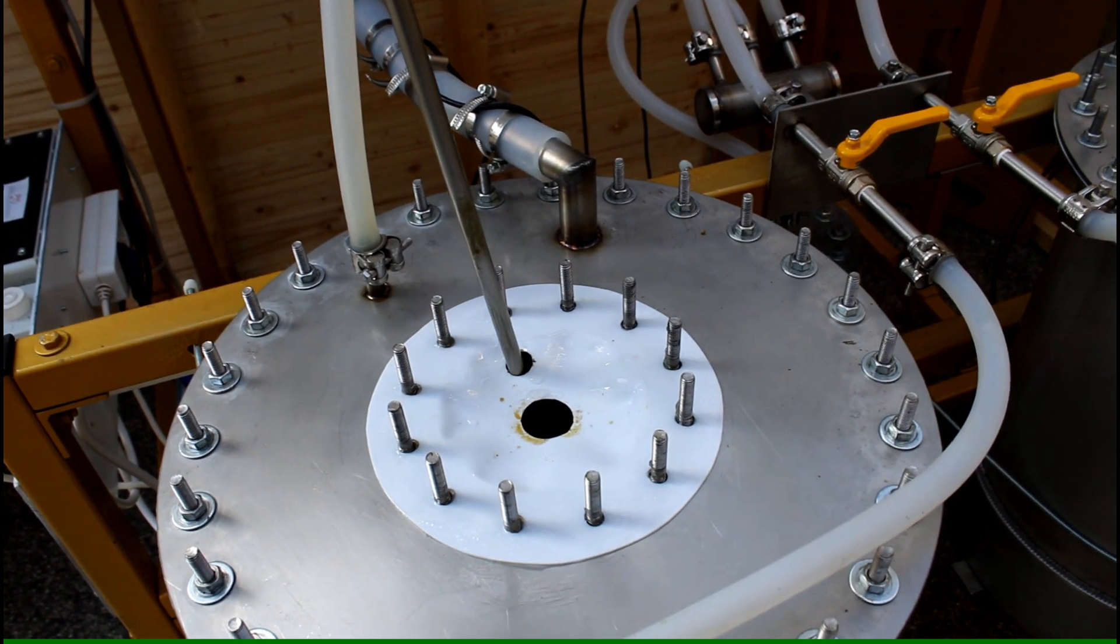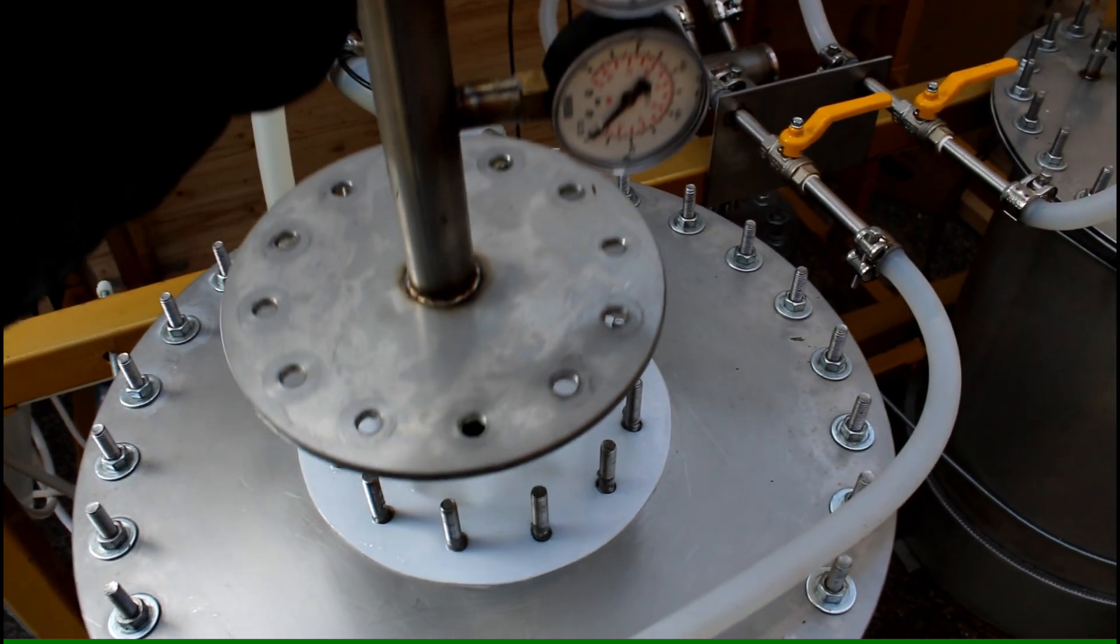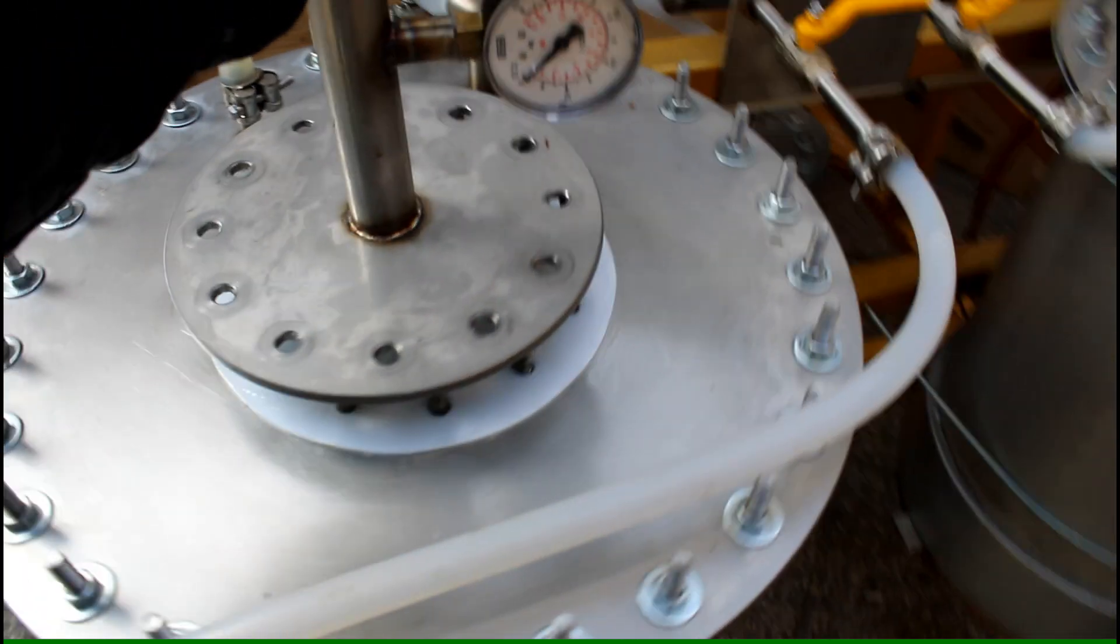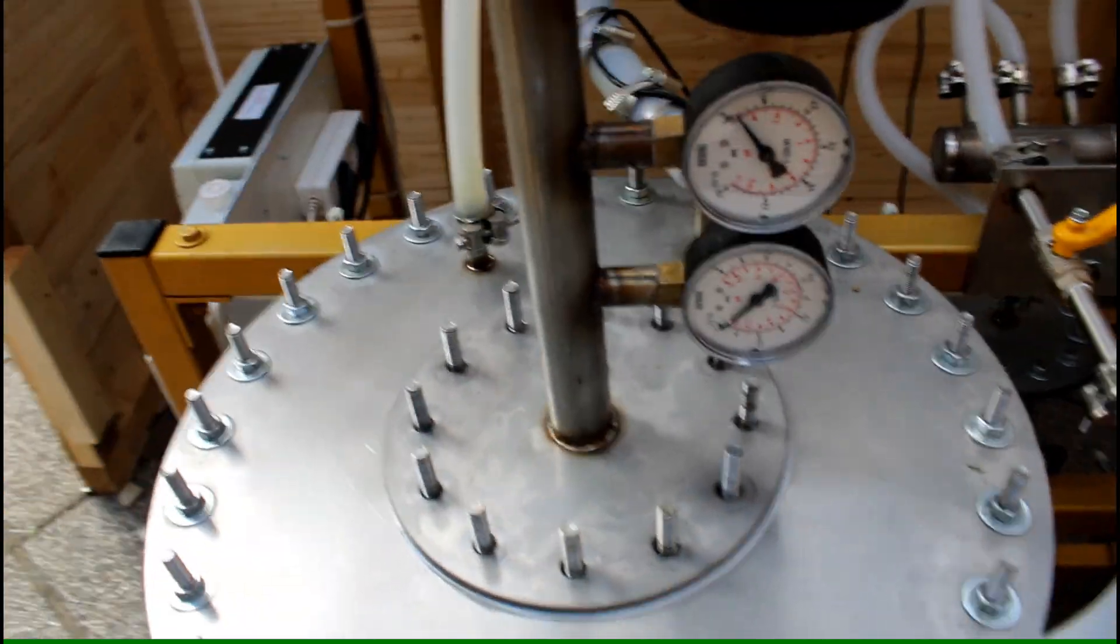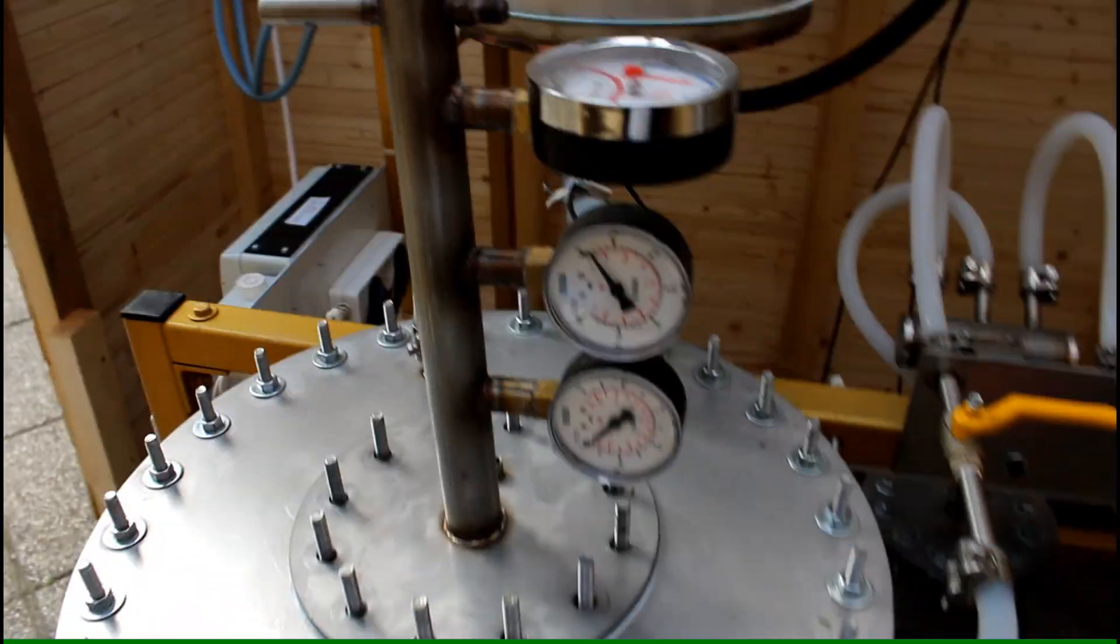Here you see the Teflon sealing and it's simply put onto it, put screws on it and that's it.